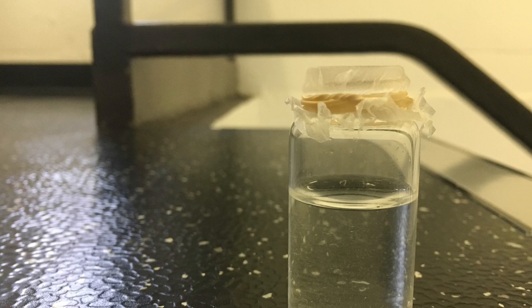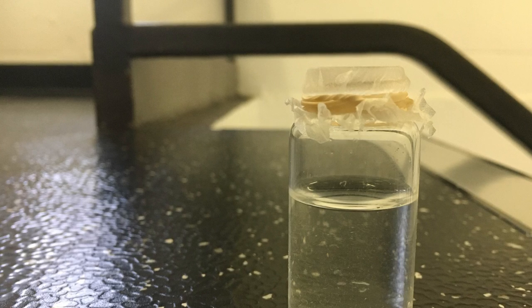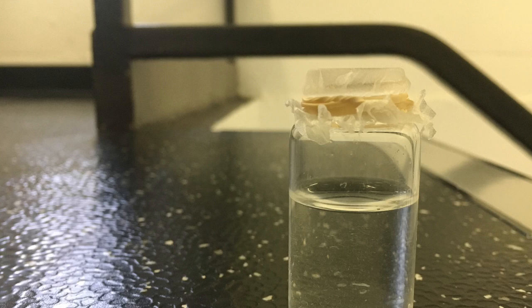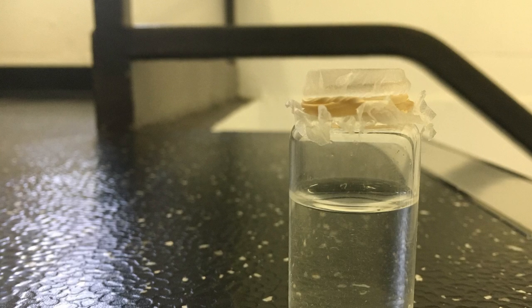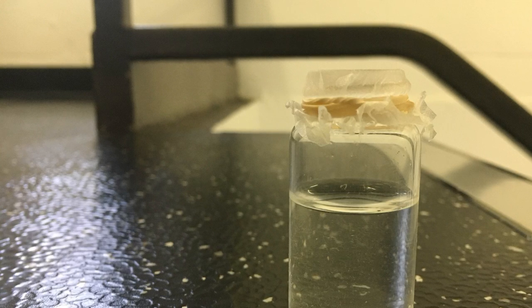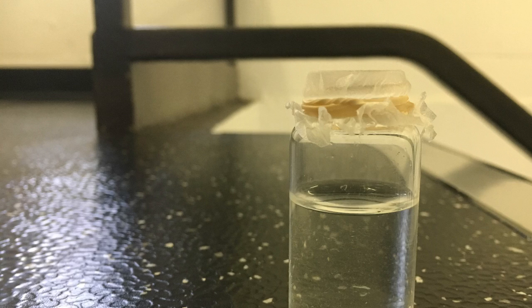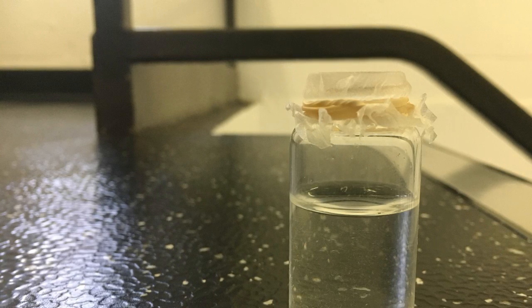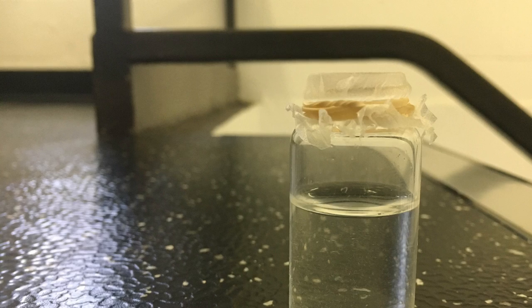Part 2 of this lab experiment is washing the alum. Pour the alum solution into a vacuum filtration system. Then you must turn off the vacuum while the alum is in the funnel in order for the alum crystals to actually be cleaned, instead of having the cleaning solution entirely sucked down the funnel.